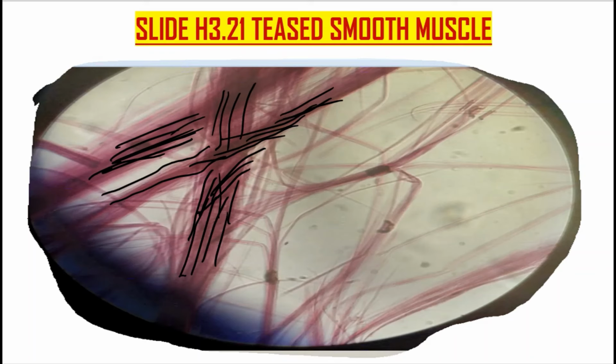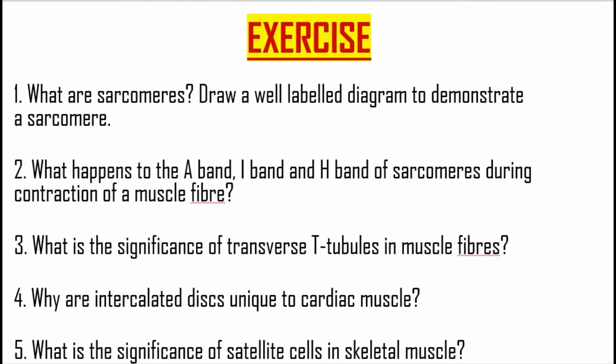The reason why this is done is to show you how the fibers run in a smooth muscle. To tease is simply to make straight, to comb, to make clear so that you can appreciate. So these are just teased smooth muscle fibers. Make a drawing and label it. This was the last slide on smooth muscle and on the histology of muscles. From here, you're supposed to do the exercise.